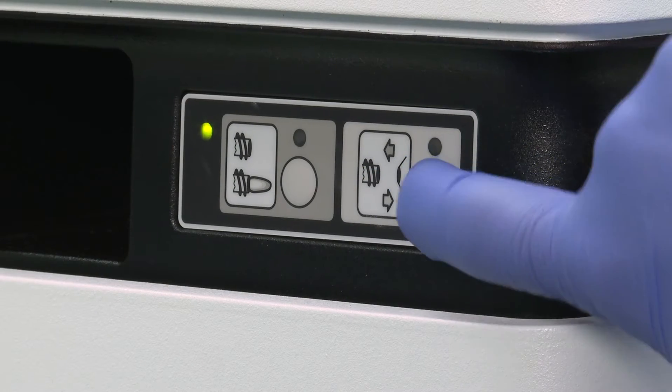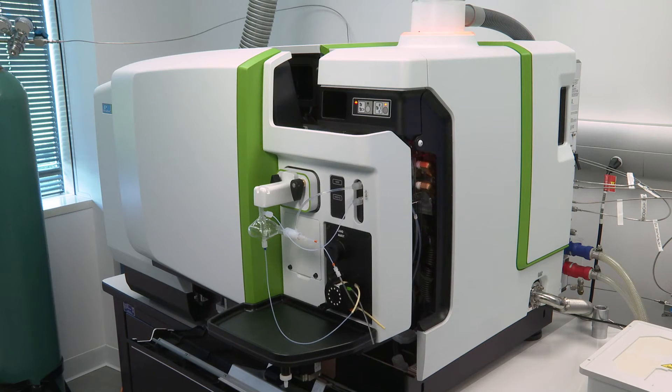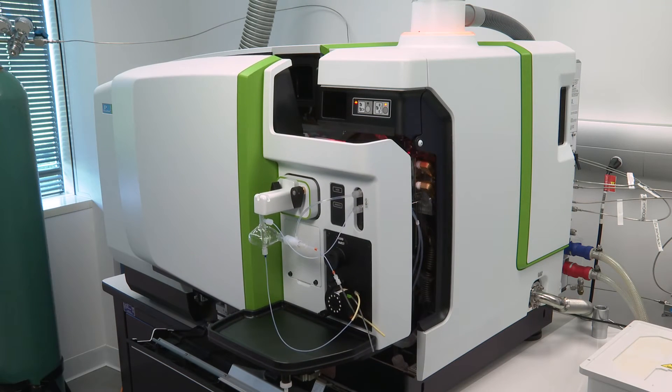To get started, press the cone access button so that the front panel moves down and away providing access to the cones.